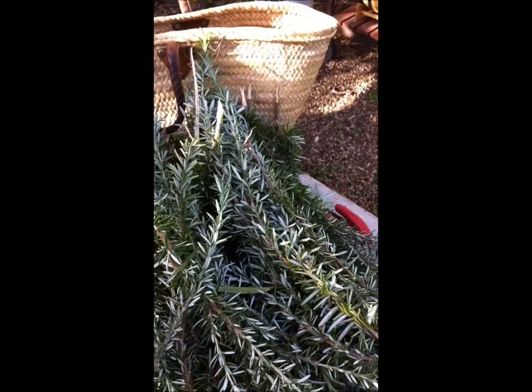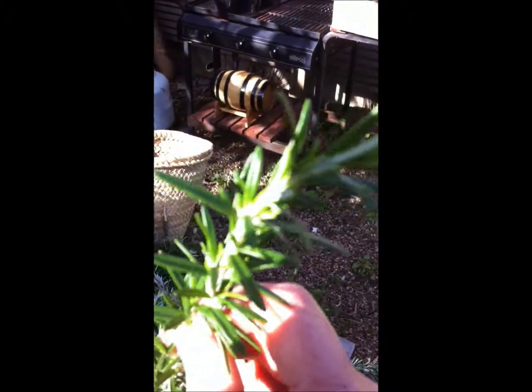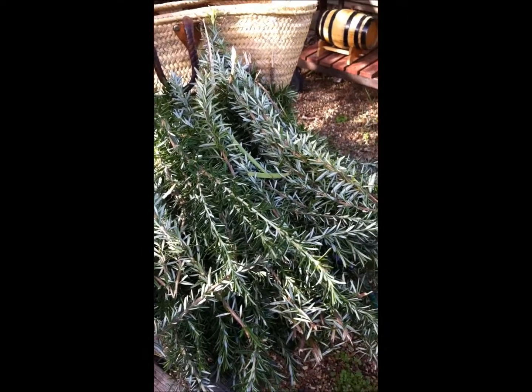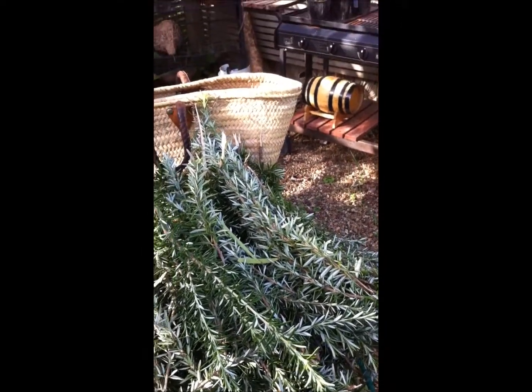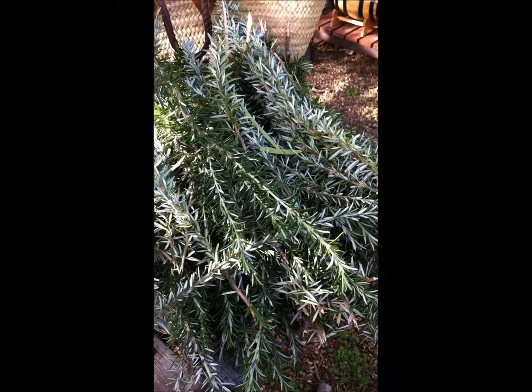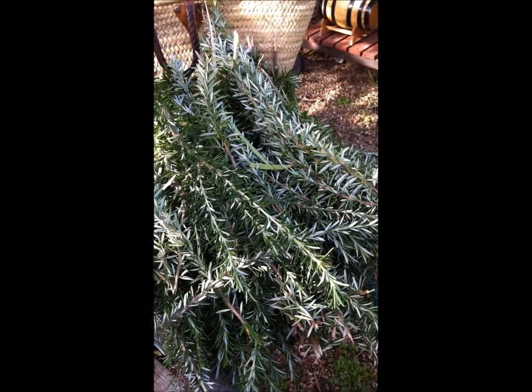I'm going to strip the leaves off the stems and just do the leaves only. It grows on a quite steep hillside where it gets a very strong sea breeze, in quite rocky volcanic soil. Not very much of it is flowering and it is autumn here on Waiheke Island. It smells quite sweet but may have a high camphor content — it's a bit late in the season, we'll see.